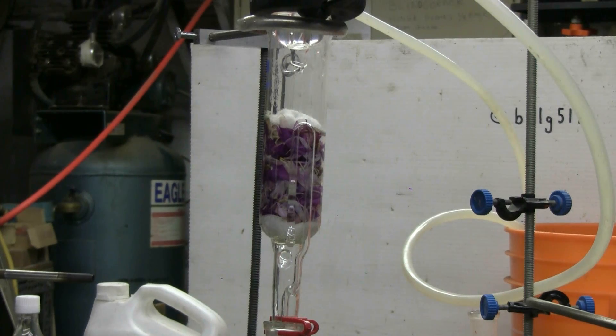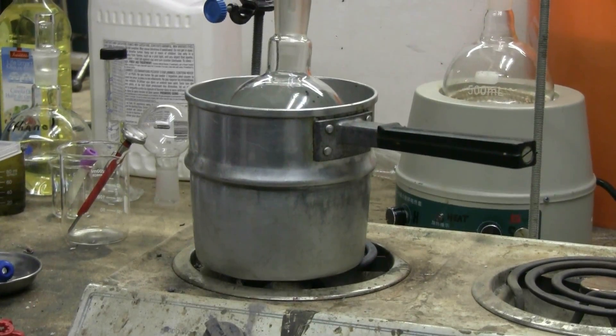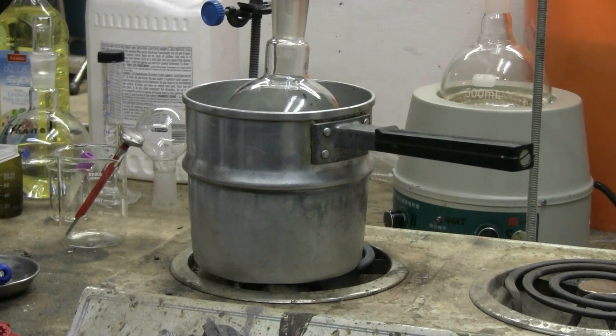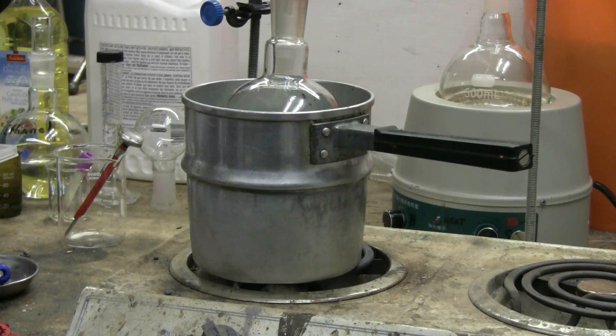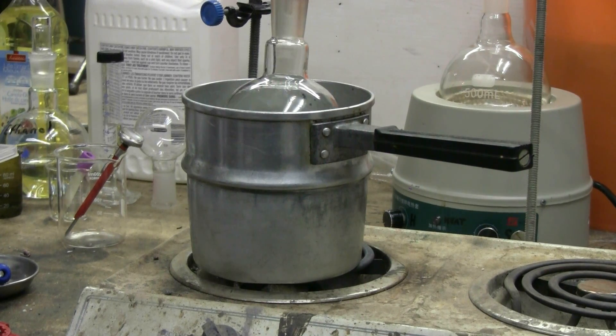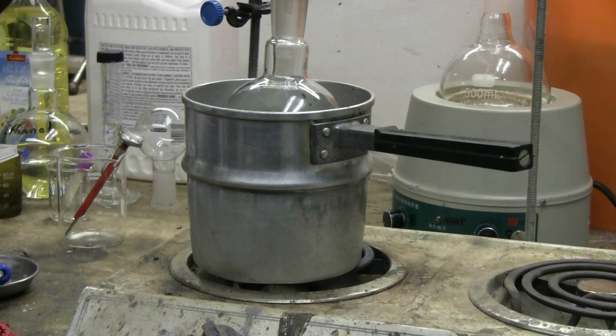The solvent I've chosen to use today is diethyl ether. Therefore, rather than using my heating mantle, I'm using a small electric stove with a water bath to warm the flask to make sure that heating of the ether is kept to a minimal and reasonable level.